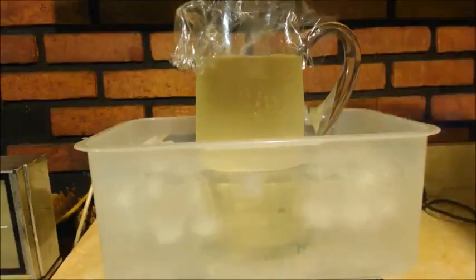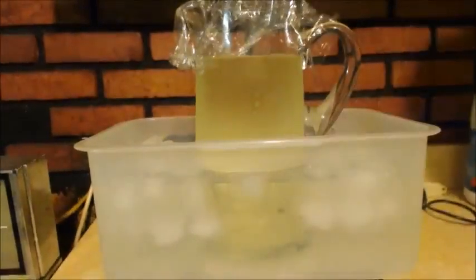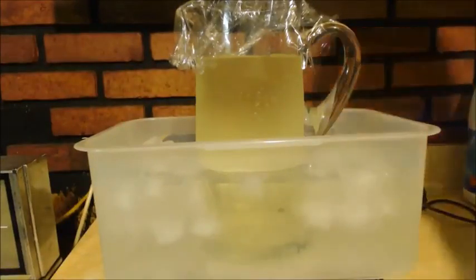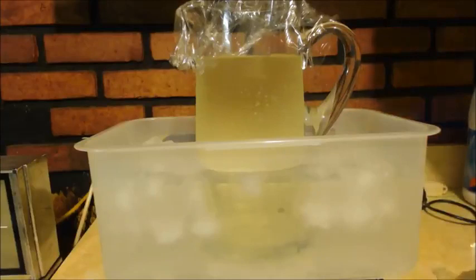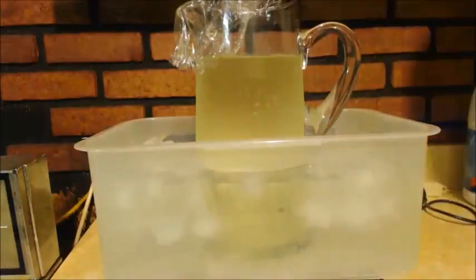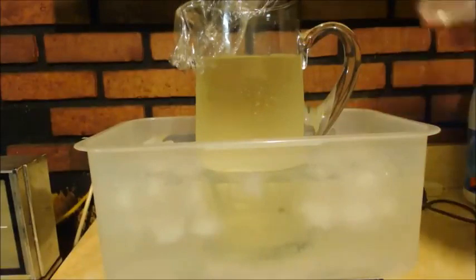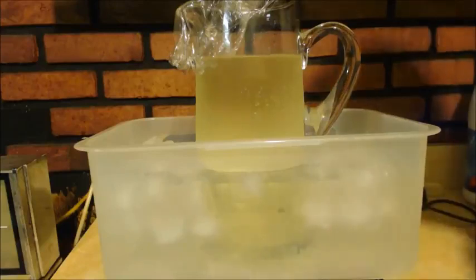All right, I got about 2,300 milliliters of Clorox, just the cheapest Great Value bleach. That's all I have left, so I didn't titrate it or anything, but you can see how green it is. I got my stir bar on there. I have 60 milliliters of acetone here. I want to add it slowly, a little bit at a time. Cooled everything down. That's at like 4 degrees. Of course, it's been sitting there a while. Alright, so I'm going to add it in. Turn up the spinning.